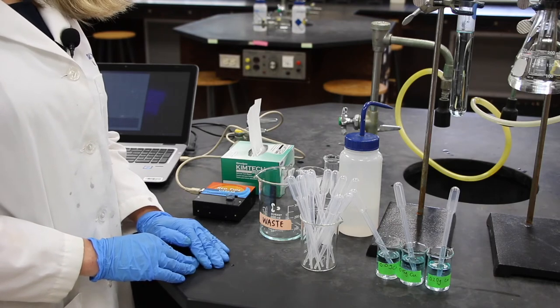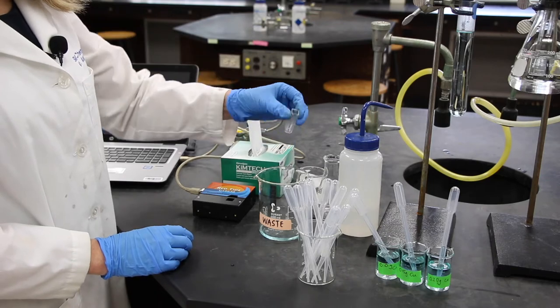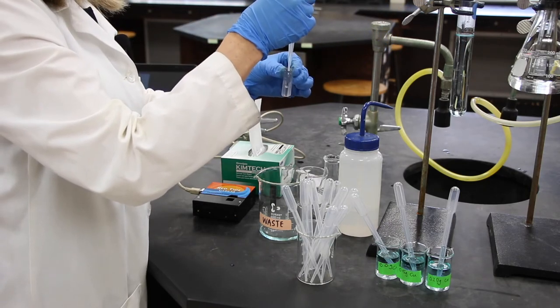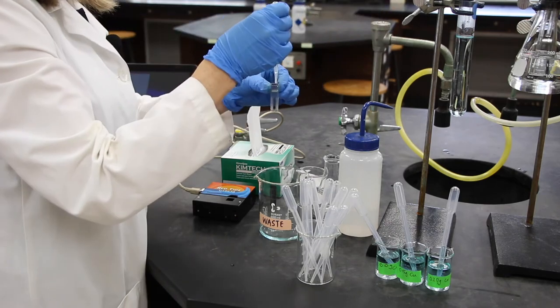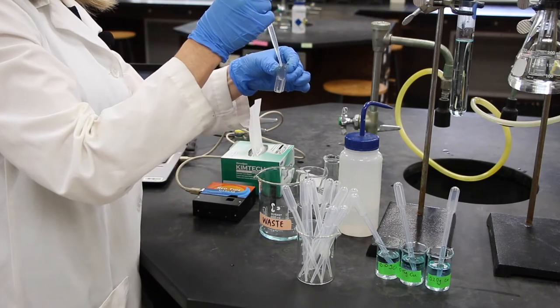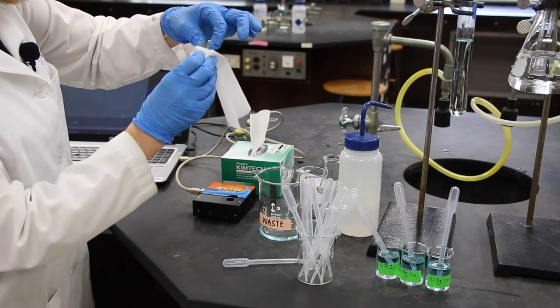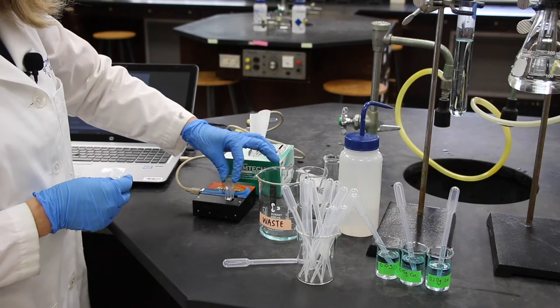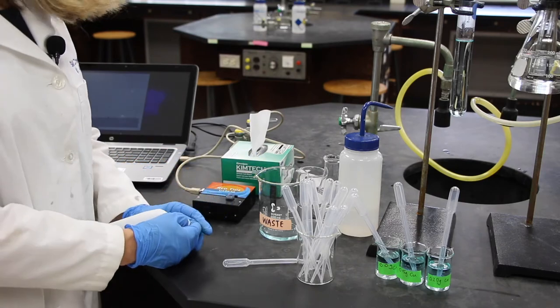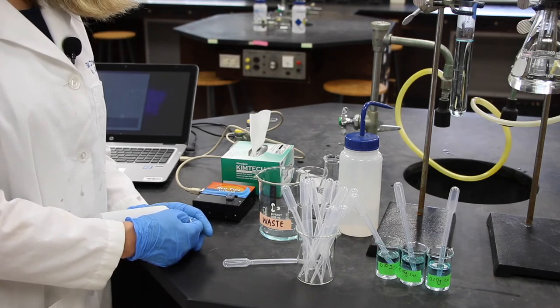Now that you've constructed the graph, we can determine the mass of copper in our sample. And so, we'll get rid of what was last in there, in our cuvette to waste. And then we'll normalize our cuvette with a clean, disposable pipette. Get rid of that to waste. And fill this up again. Again, take a Kim wipe. Wipe the sides of the cuvette. Again, only holding by the top. And put it in the spectrometer with the diamond facing us. And we can now read our absorbance. And then from the graph, you can determine the grams of copper per 50 mils of solution in your sample.